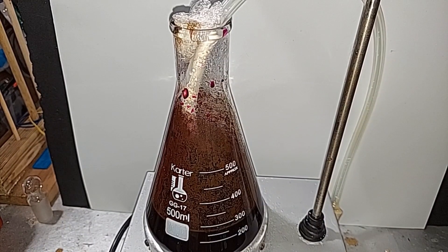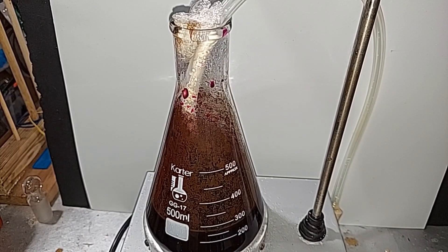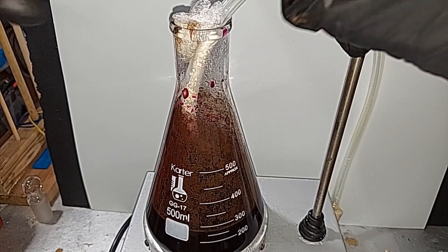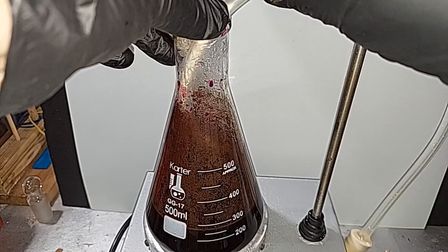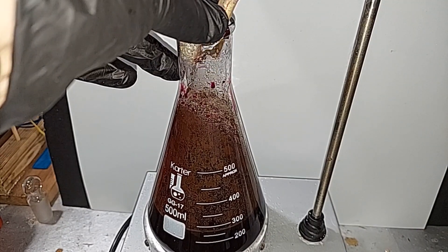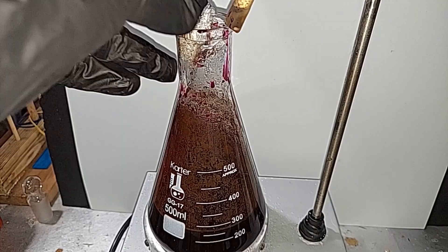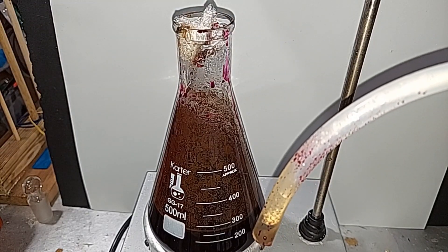Okay, I've already turned off the heat. I'll turn down the magnetic stir here and take out the last bit of tubing. Everything else has been safely dismantled. You can clearly see a very nice purple-colored solution in there.